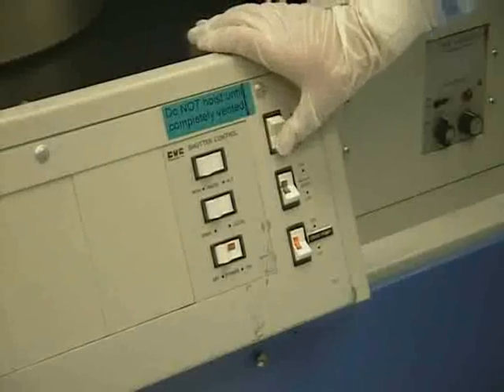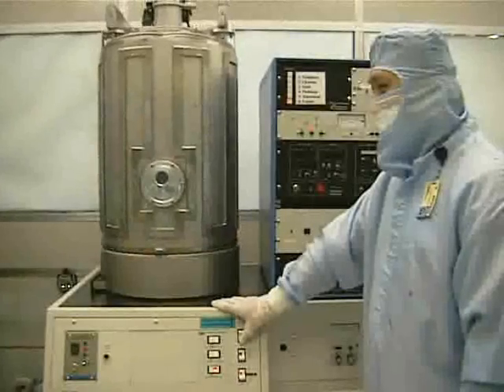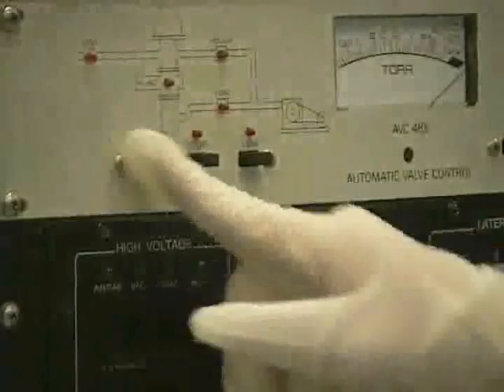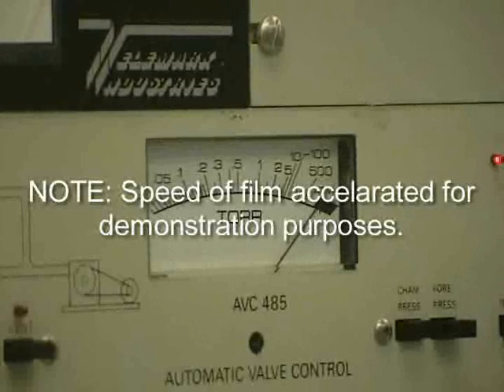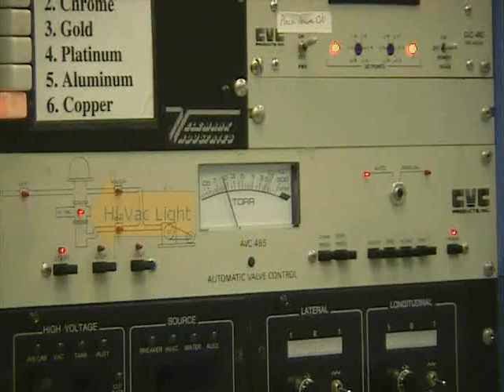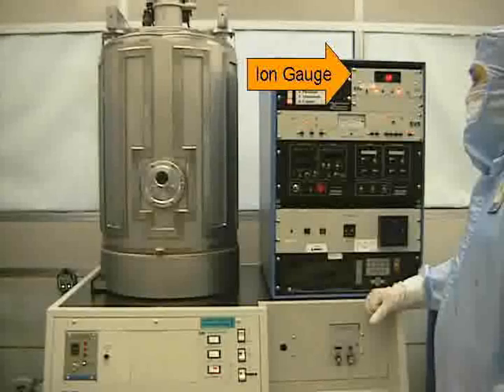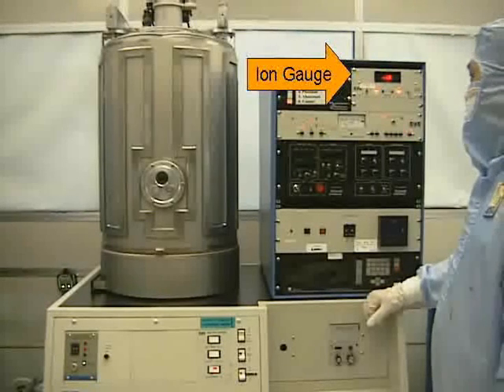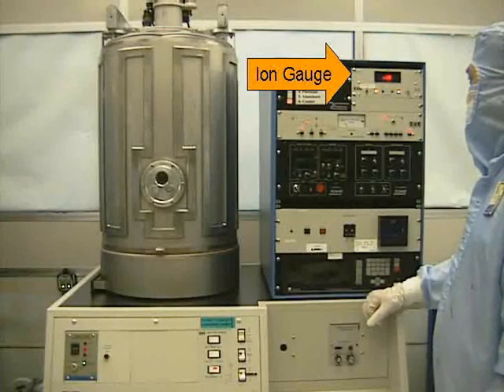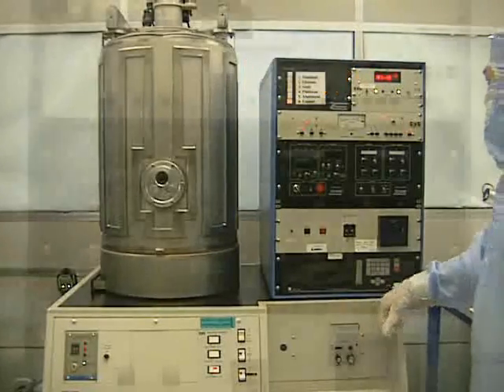Now hoist the chamber down by pressing hoist down on the hoist controller. Once it has been hoisted down, press the start button on the valve controller. This will start pumping the pressure of the chamber down. After a few minutes, the chamber pressure needle will start moving and go down to about 0.5 torr. The high vac light will then come on, indicating that the valve is open for the cryo pump. Soon after, the ion gauge controller will come on. This is indicated by the lights on the ion gauge controller changing from red to green and the counter displaying the decreasing pressure of the chamber.